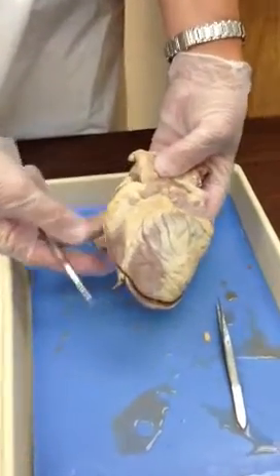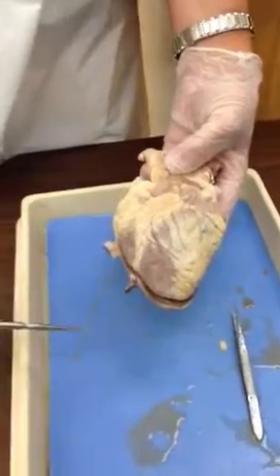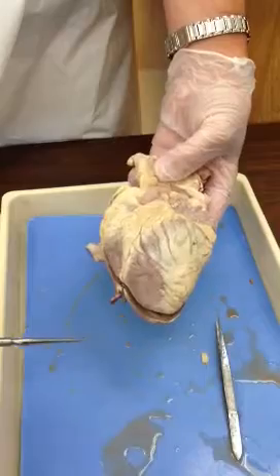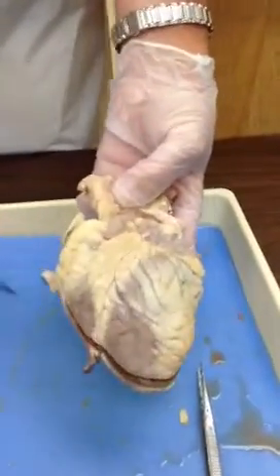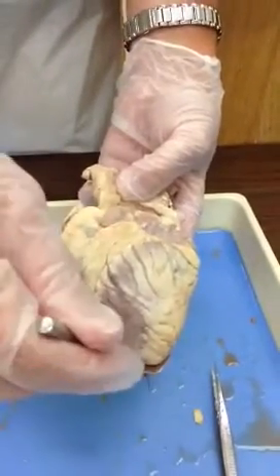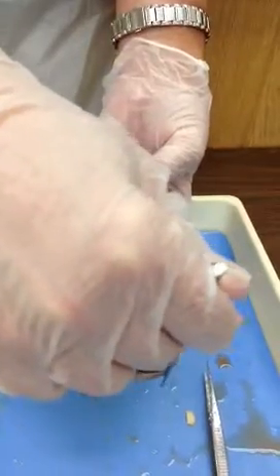All right, so dissection of the sheep heart. We're looking at all the structures on your list for dissected heart. Start with apex. Apex is going to be right here. As you look at the shape of the heart, obviously it looks more pointed. The apex is going to be a landmark to tell you your left.